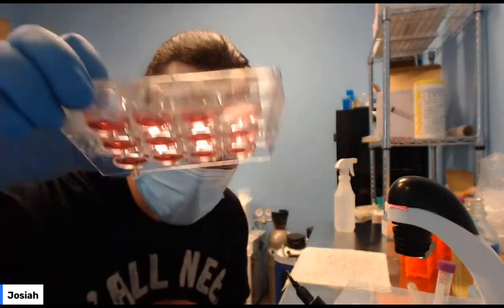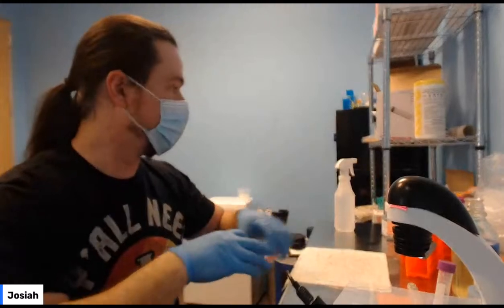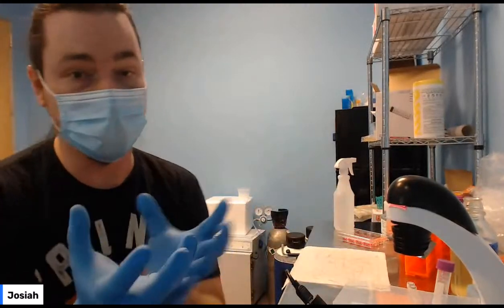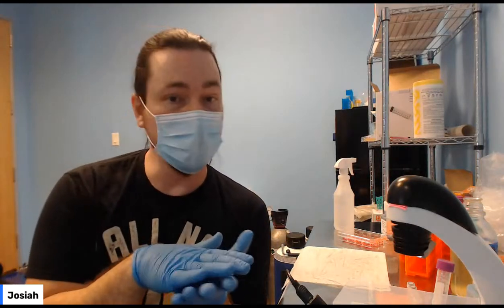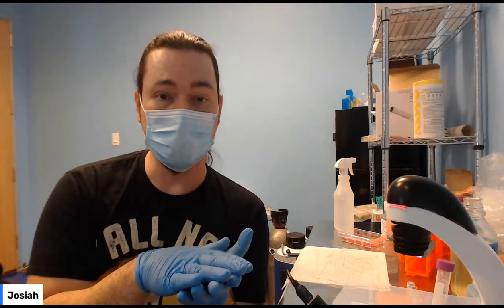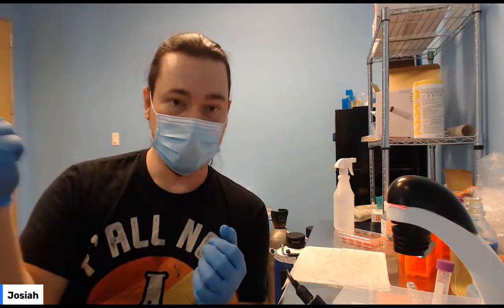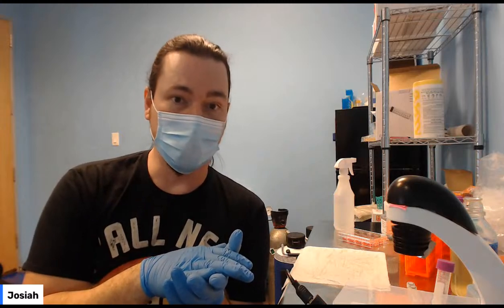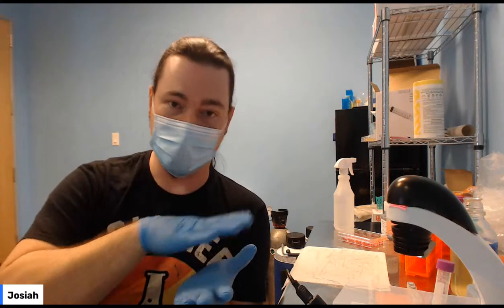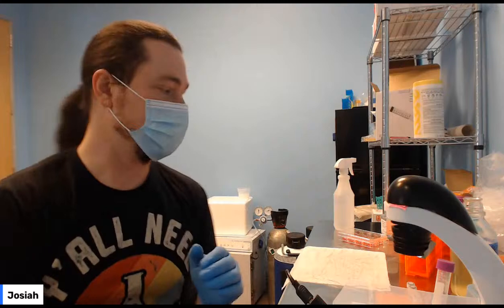It's best if you put a cup of water in whatever your incubator setup is, if you have it in an enclosed space, because it'll really dry out. So check your liquid levels in the plates, and if need be, change the media. Just suck the media out and add more media, because if the wells dry out, they'll turn yellow and all the cells will die, and that's it.